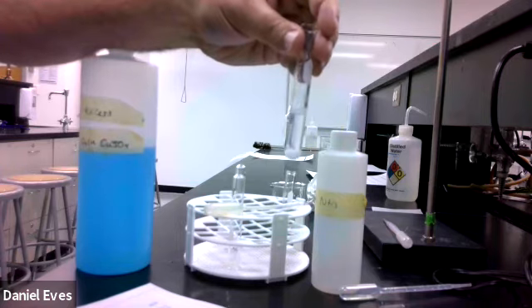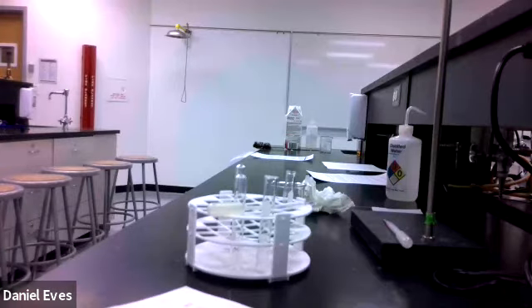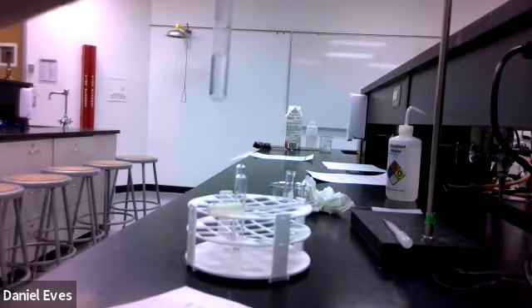You won't notice it, but I'm just letting you know, and then we'll come back when this has all been dissolved. Okay, we've let it sit and we've stirred it and we've made sure that we have a saturated solution of this. So we're gonna go ahead and pour off all the liquid from the top of this and put it in a different test tube.